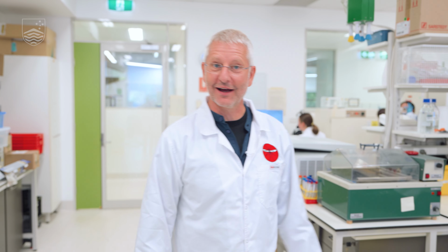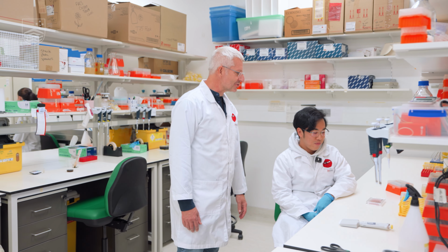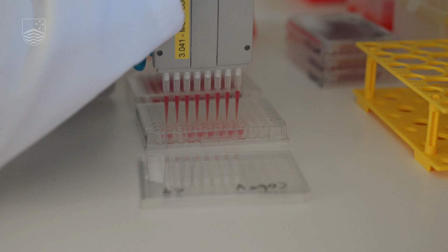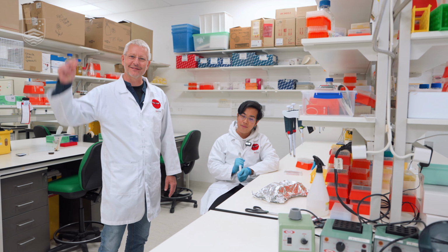Okay, we looked at parasites of wildlife, in this case wombats, and now we are moving to a parasite that affects humans, malaria actually. So Sam over here works on malaria, and he will show you what he's doing in terms of finding new drugs. And for this, we will switch off the light.